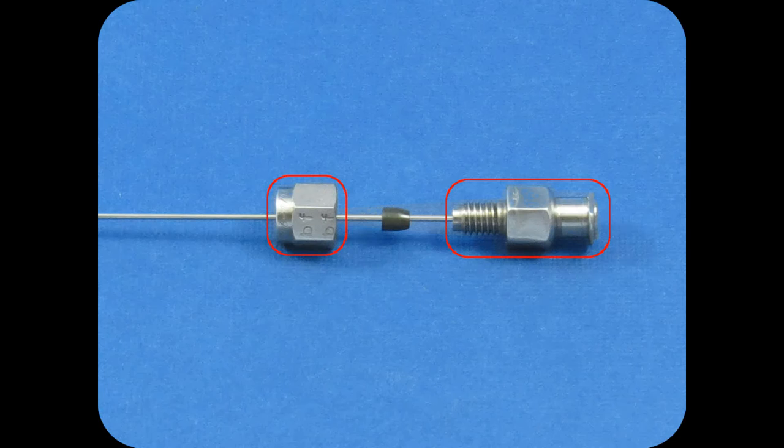Finally, you'll need one of the stainless steel luer to compression fittings. The female luer fitting is available in either a 1/16th inch or a 1/8th inch compression fitting, which you will select based on your ferrule size.